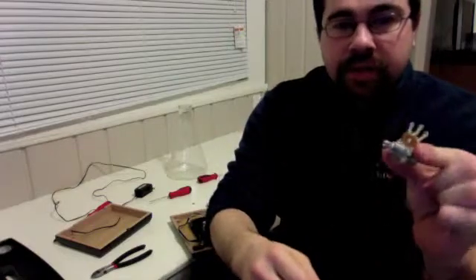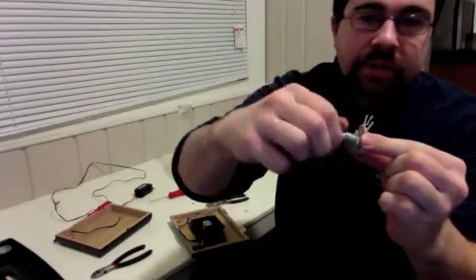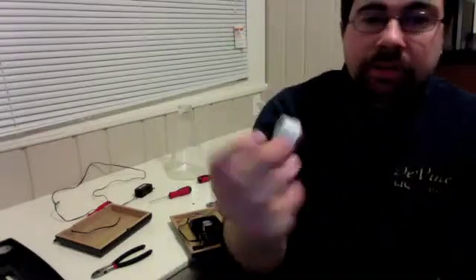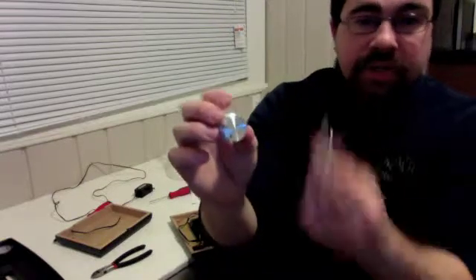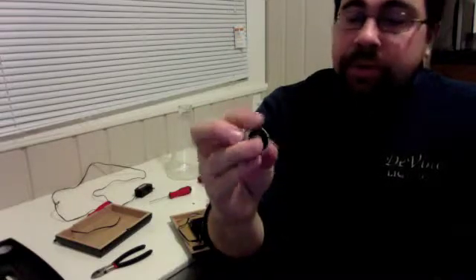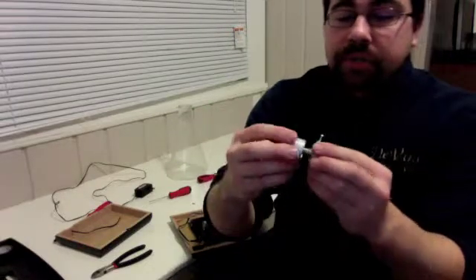If you use the middle one with one of the other 2, that's all you're going to need. Then this little knob on the end, this spins. That's going to control the current flow, which is in turn going to change the speed. And then you can get a knob like this, same place you get this guy, and this will cost you probably about $2. You'll get 2 of them, and that's really about it. So I'll be back in just a moment.